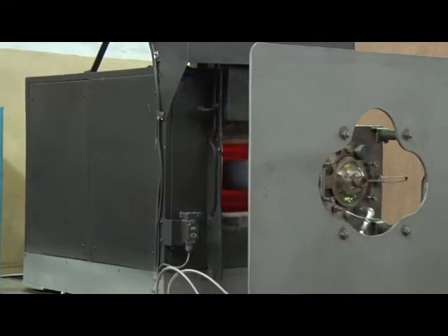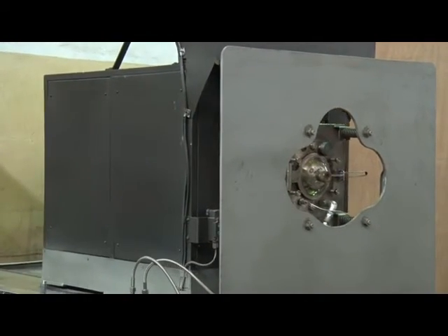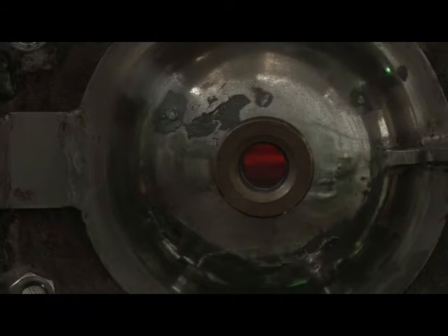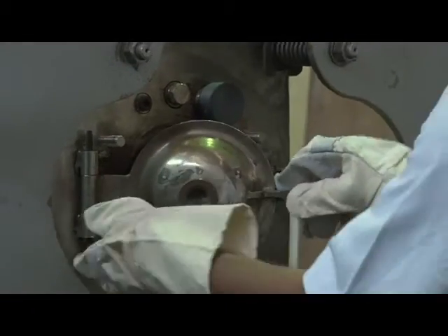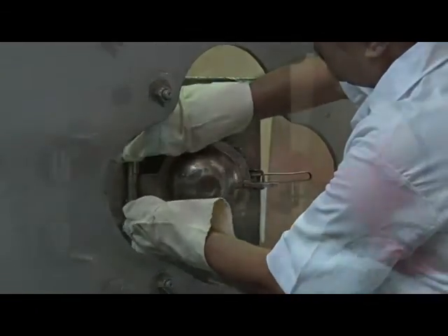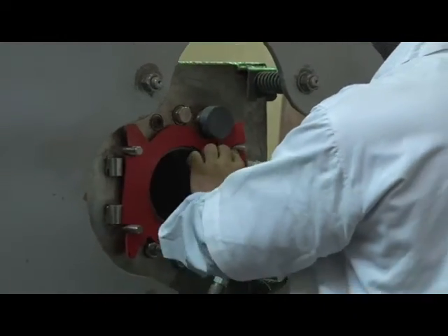The chamber loaded with specimen is now engaged with the heating furnace to simulate a batch annealing cycle for durations as long as 40 to 50 hours. The simulator can easily be converted from batch to continuous annealing mode by simply attaching an auxiliary cold chamber to the hot chamber.